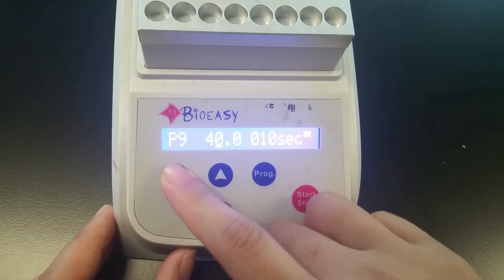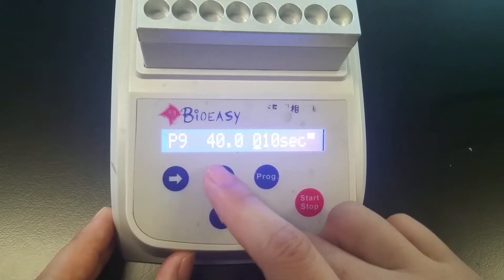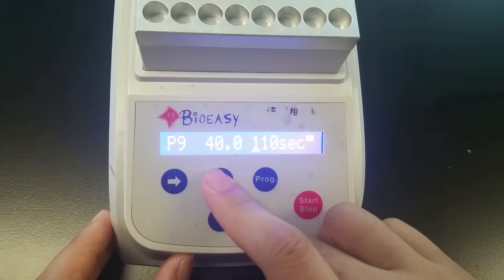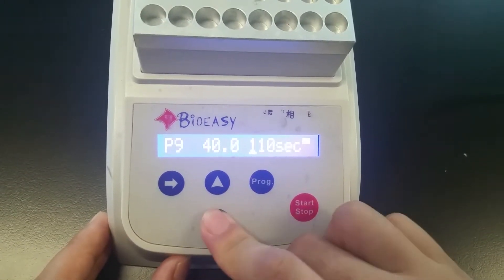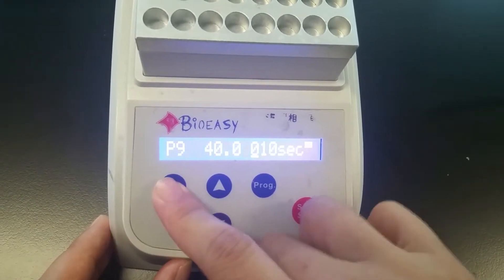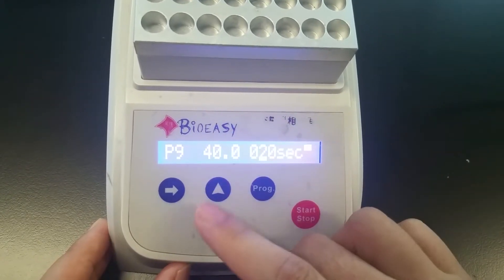And the cursor will move to the time setting. Again, we can adjust by the up and down buttons. So we adjust it to 20 seconds.